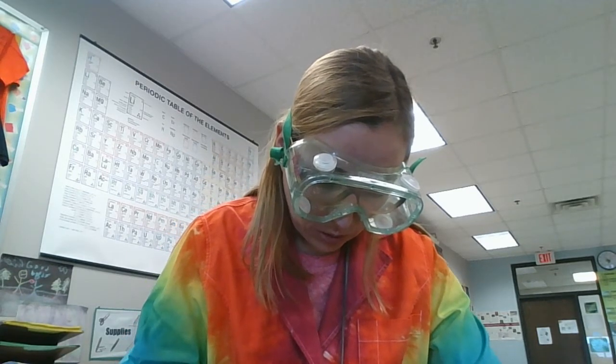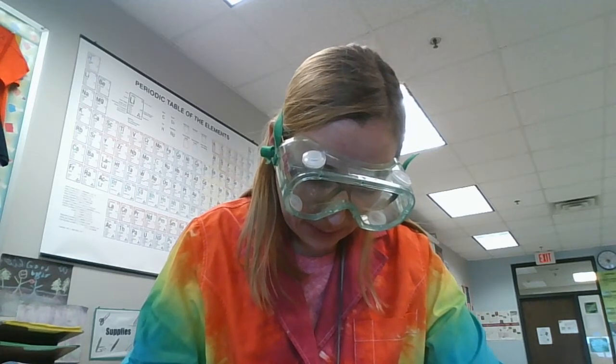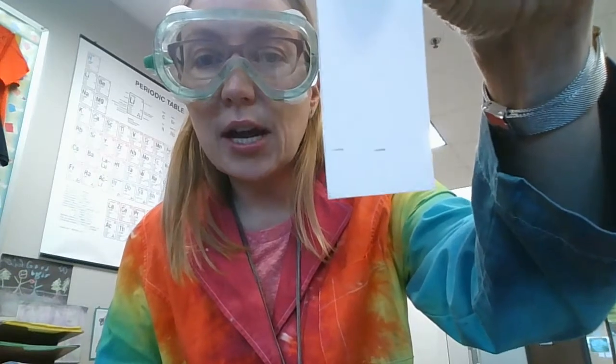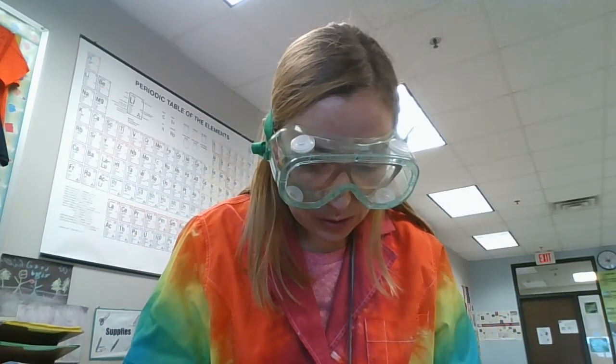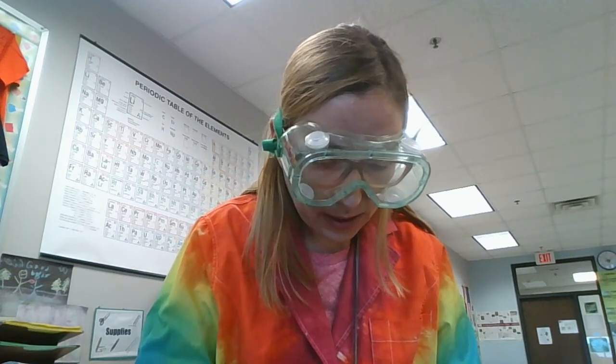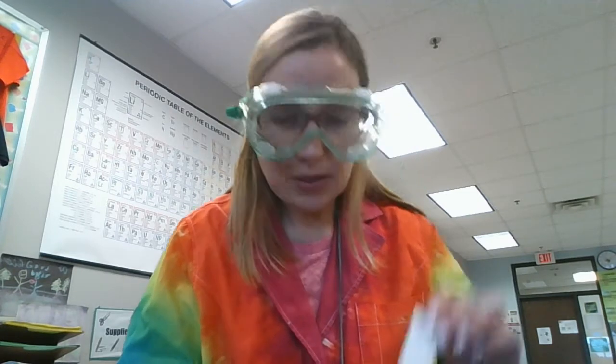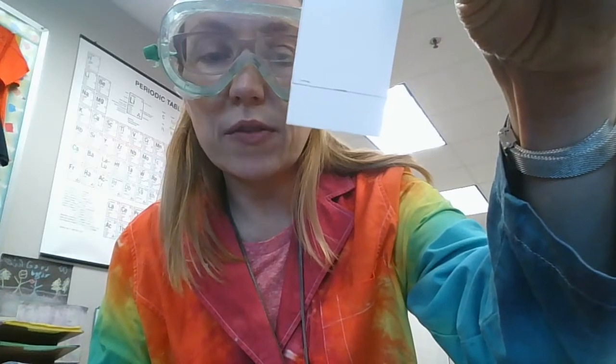So what I'm going to do is make two little one centimeter lines on my plate. I just made a couple of one centimeter hash marks on my plate, and then I'm going to use those to make a nice straight line along the bottom of my plate. A one centimeter line is perfect.